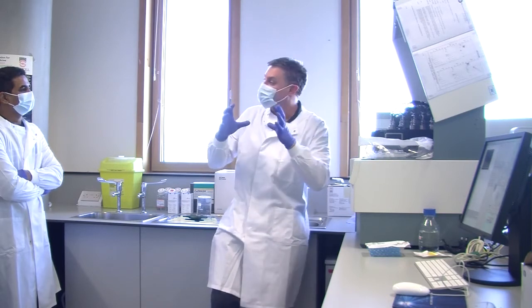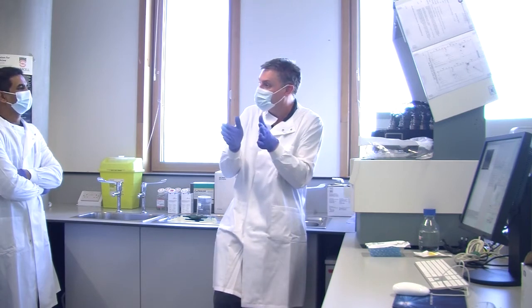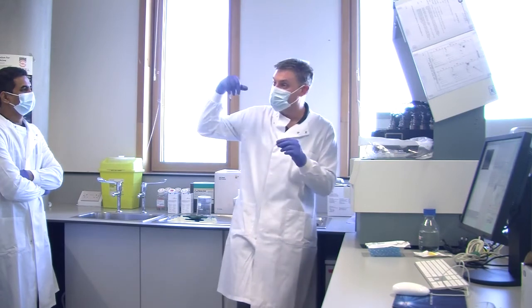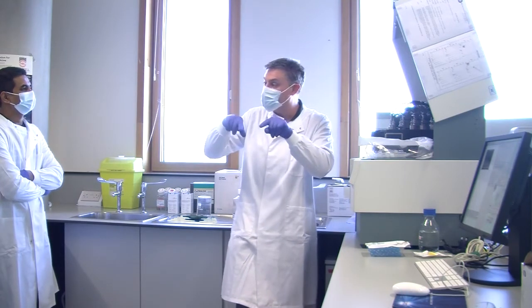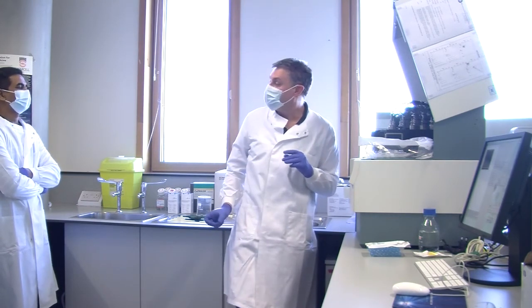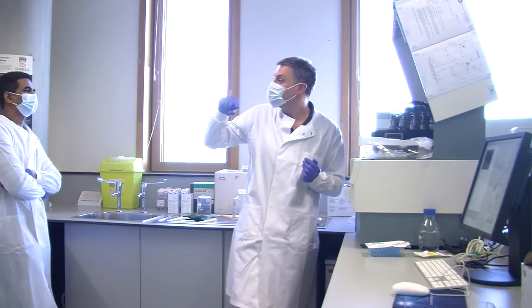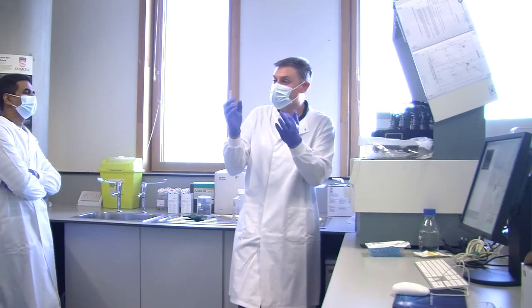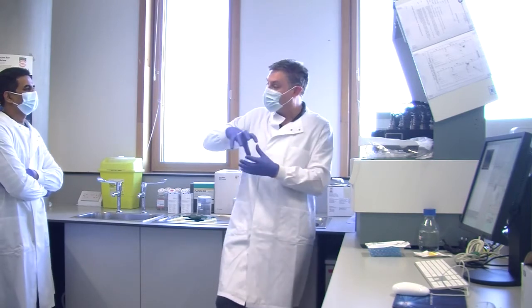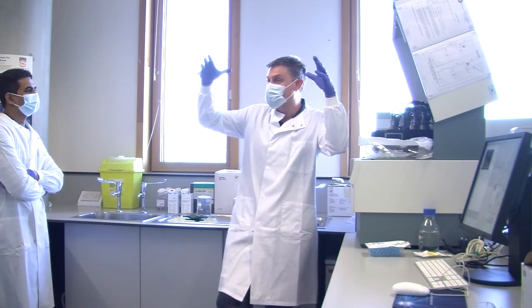So fluid dynamics says that if you have two streams, but you haven't got turbulence, they don't mix. Okay? And you can actually see demos of this on the internet, where you have an angled board and you run red coloured water down in blue coloured water, and as long as you've got a really smooth surface, you get a red and a blue line of water coming down. They don't mix together. If you then put some little crenulations or whatever, all of a sudden they mix, and you get a sort of dirty brown colour as all the colours mix. So the sample going up through that V shape doesn't mix with the PBS coming in around the outside.